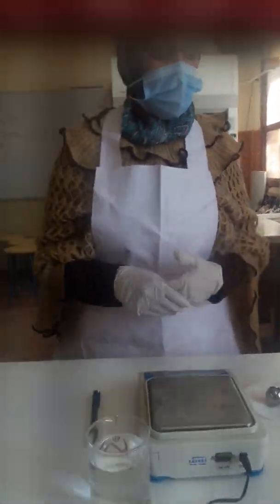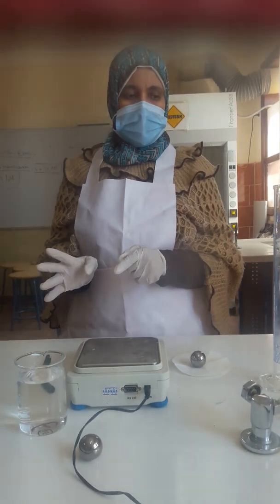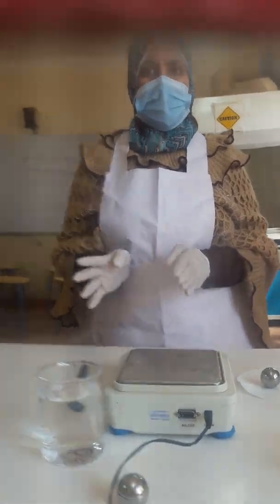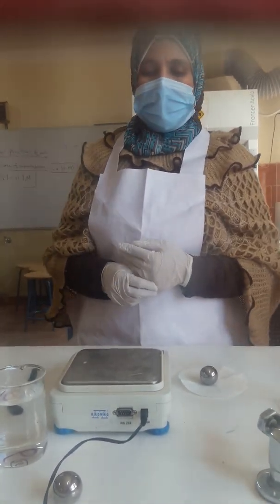Grade 10 STEMers in a STEM school. First we start with the practical experiments for grade 10 first semester. I know we did it before, but now we want to review it. Okay? Let's start with the first one: how to calculate the density of matter.